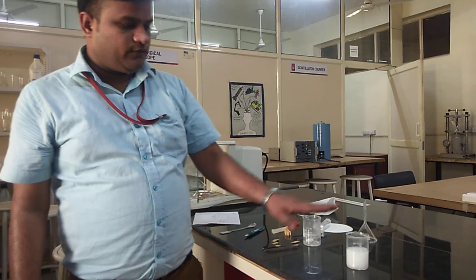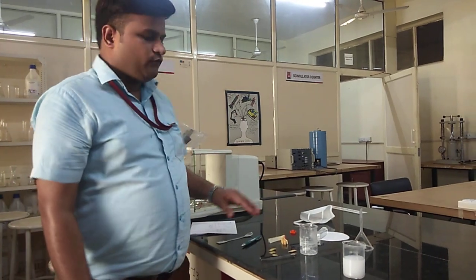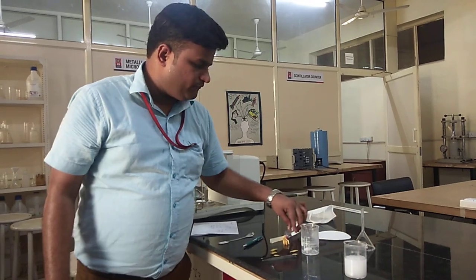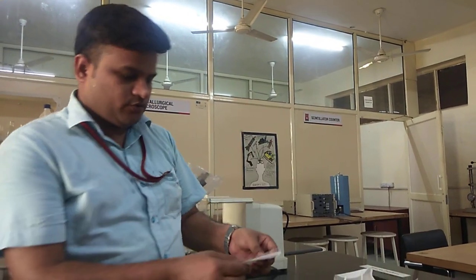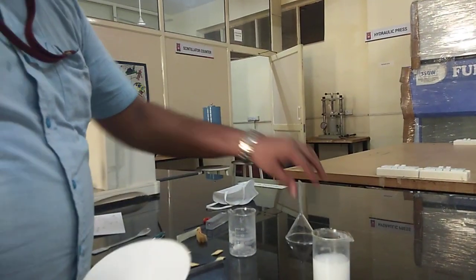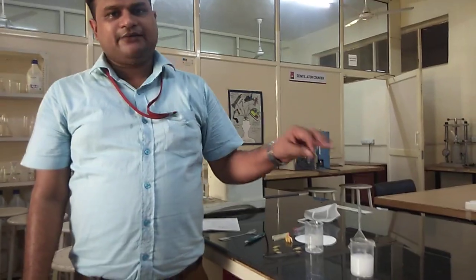After reaching pH 8, the final step is to leave the solution for 24-hour aging at room temperature in an open atmosphere. After aging, we will filter the white precipitate through this filter paper using a funnel — the filter paper has pores in the micrometer dimension. We will continue making and adding solution, leave it for 24 hours, and then show you the result. That's all for right now.